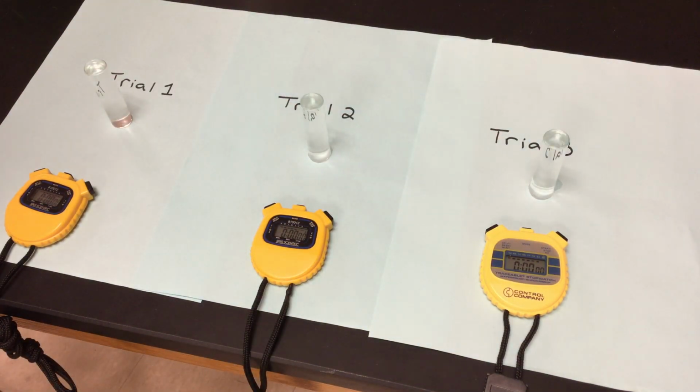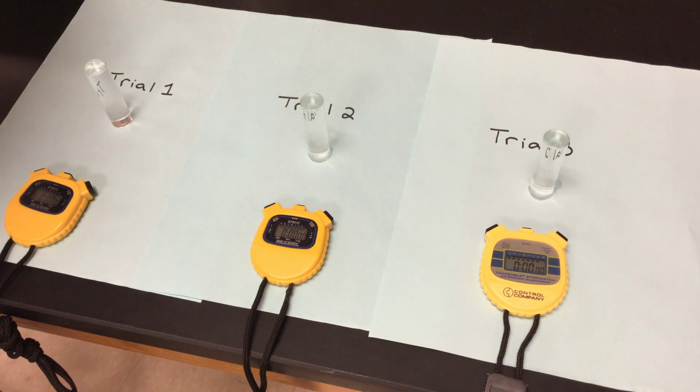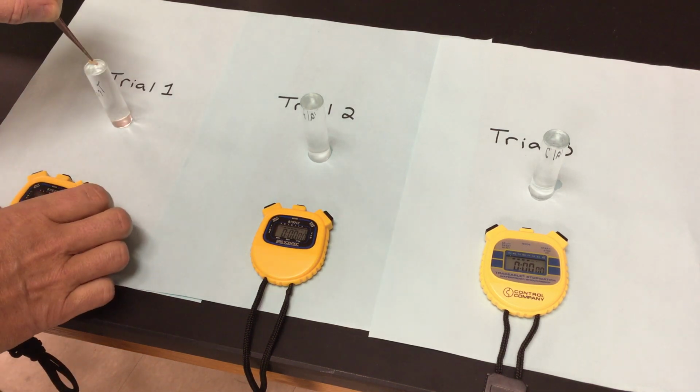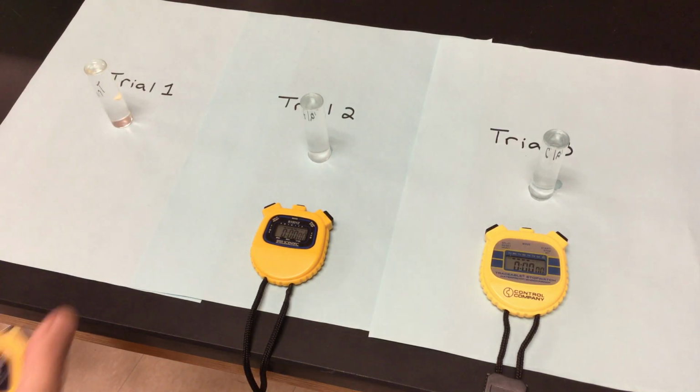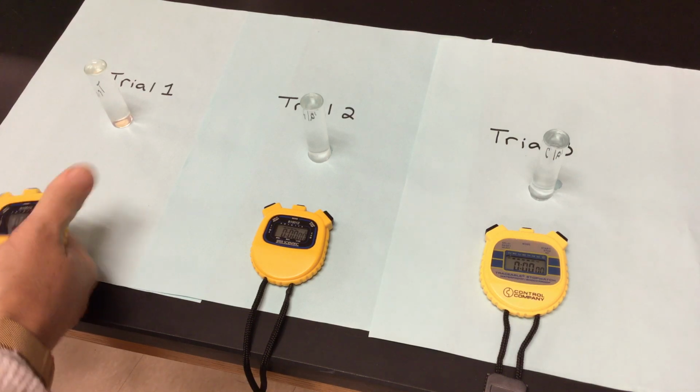I'm going to go back to my filter paper discs and do the same thing that we did before. And we know we were a maximum of 4 minutes. So hopefully we get a little action going on here. Stick it in my yeast solution. I'm going to drop it in. We're going to let it hit bottom before I start that time. So it's going down and we start.